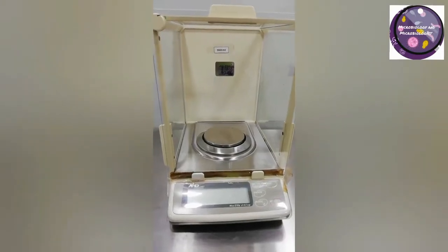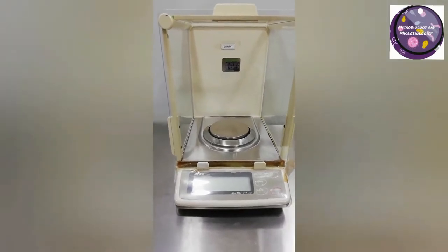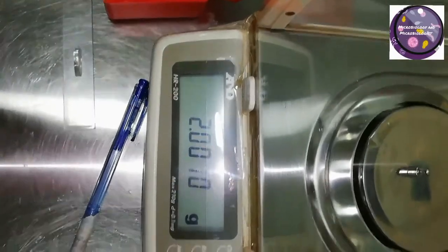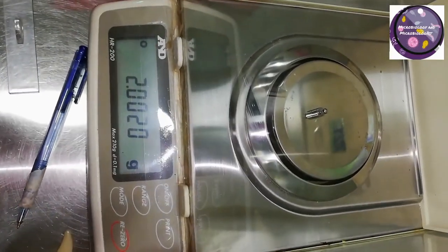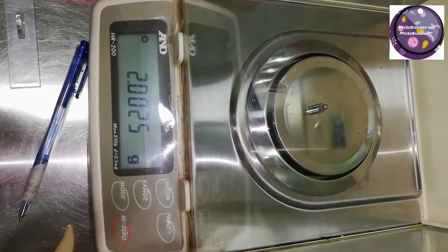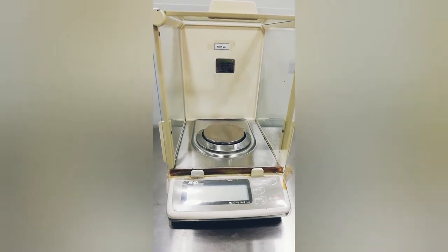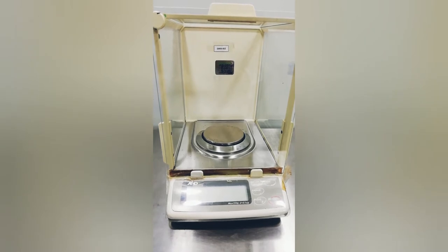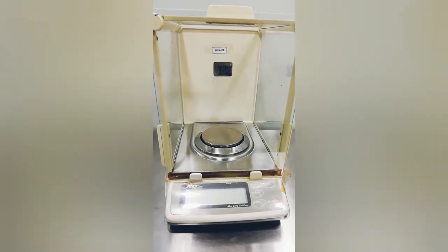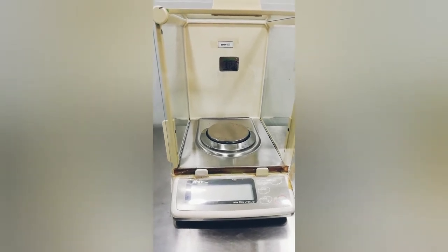Calibration on a suggested frequency and verification on a daily basis is important for each piece of equipment in a quality lab or microbiology lab. Weighing balances or electronic scales are verified on a daily basis before starting work, using calibrated weights. Weighing balances are essential instruments for microbiology labs, quality control labs, and some production areas. For microbiology labs, we use them for media preparation, buffer preparation, and sampling.